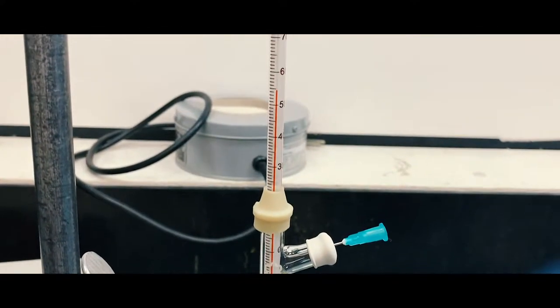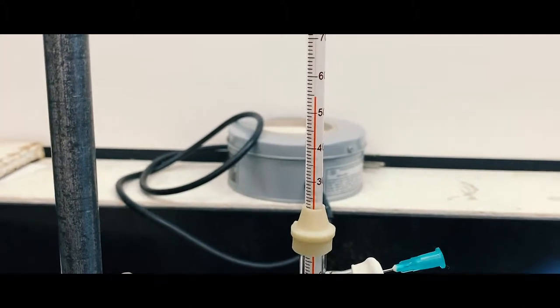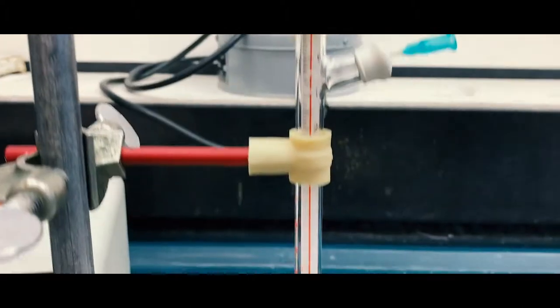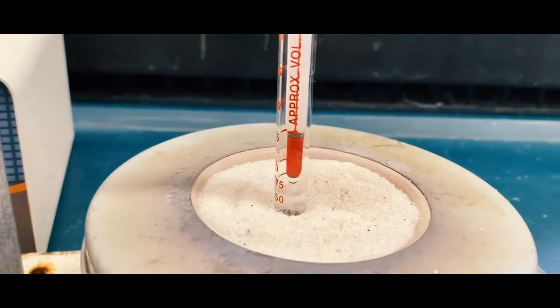Later, you can wait until the highest temperature is reached and it stays for one minute, and record that temperature as the boiling point.